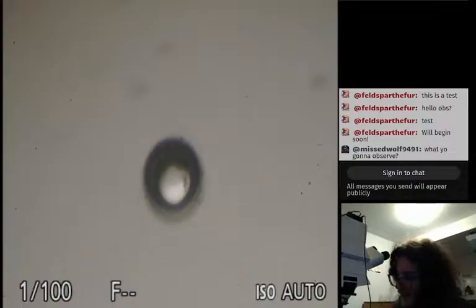But right now we shall move to the little pollen guy, the little guy that makes me want to die during the... What's this? Bubble. But this guy causes me problems because it is making me sneeze all the time, like during the spring, because pollen.